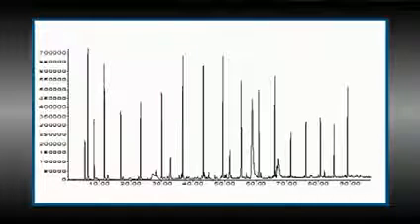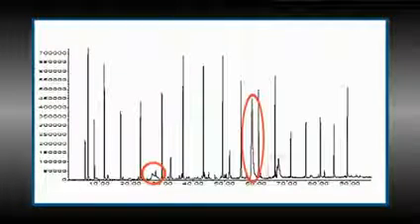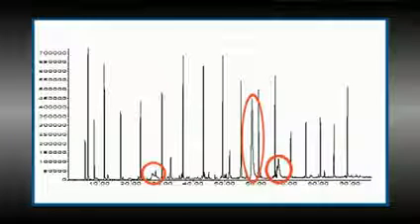Have we gotten all our ghost peak problems? Not yet. Another thing we should consider is whether you might be getting carryover from previous injections or semi-volatile contamination. If the ghost peaks widths tend to be broader than the normal sample peaks right around them in the same part of the chromatogram, this is usually sample carryover. You'll see two examples on the screen of what carryover looks like. This carryover indicates that not everything is eluting from the column before it cools down for the next analysis.